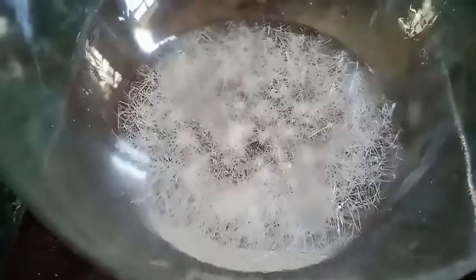I have also tried this same mixture two times, but in the second set of mixture I got different results that I will show you later on. In the first set I get this kind of beautiful crystals of aspirin.